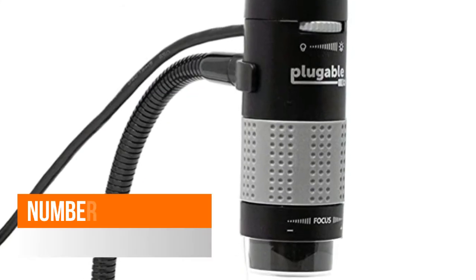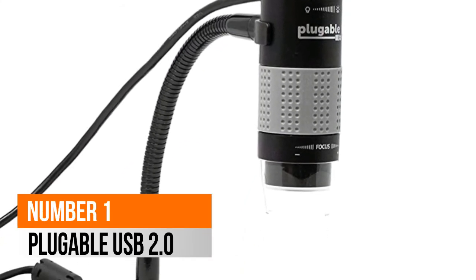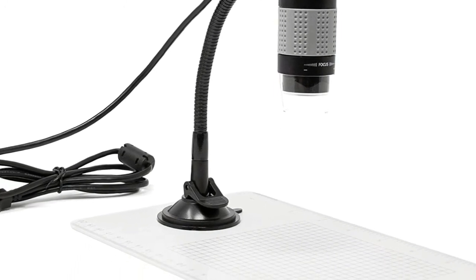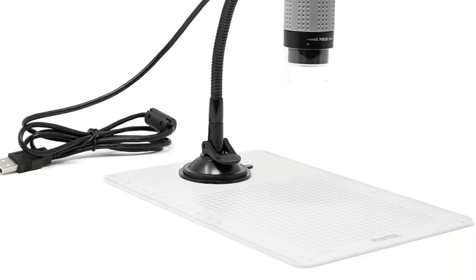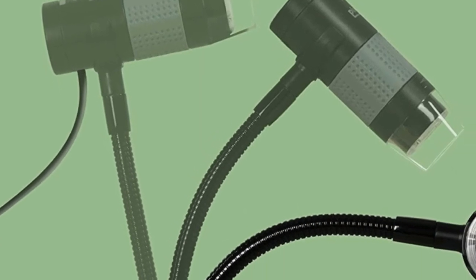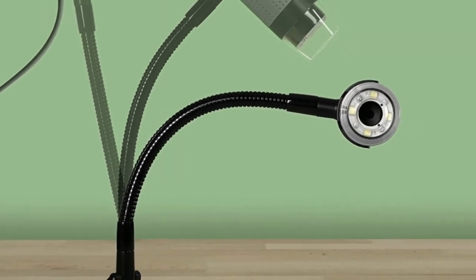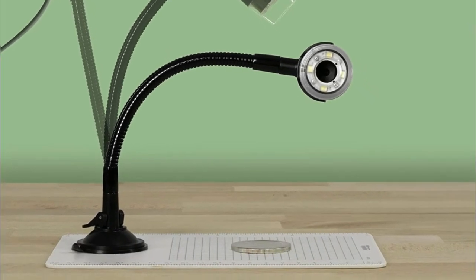Number 1: Plugable USB 2.0. Useful and fun for students, collectors, testers, and anyone interested in exploring the microscopic world. Uses a webcam chipset and sensor to support nearly any operating system using standard webcam software.